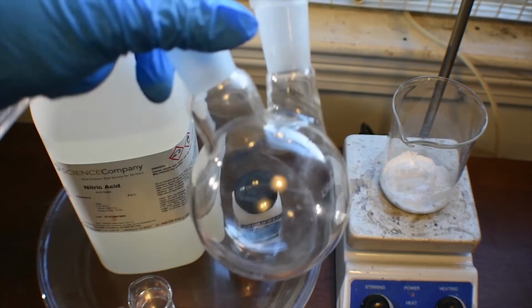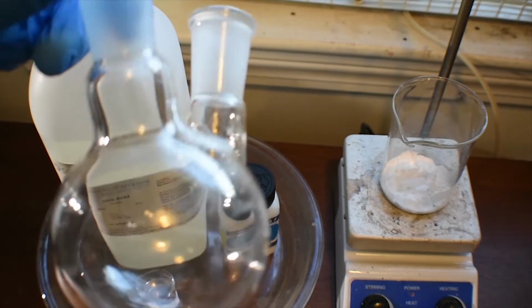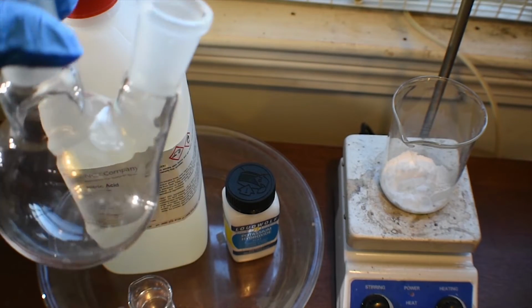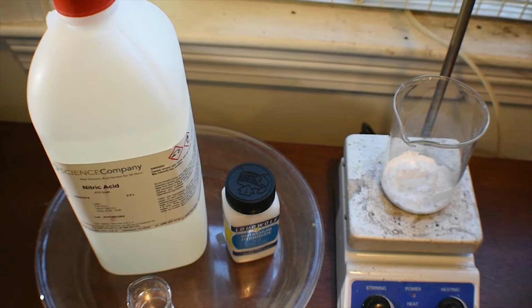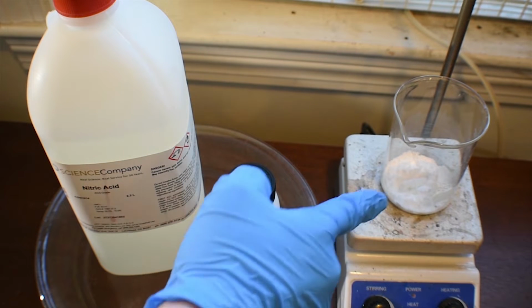So, yeah, let me go fill this up with cool water. It's going to be used as sort of a crude condenser. I guess you could use a condenser, but you'd need a gas outlet for the nitrogen dioxide, so this really kind of works best. Okay, first I'm going to turn my ventilation on low. And then I'm going to add the nitric acid to the inositol.